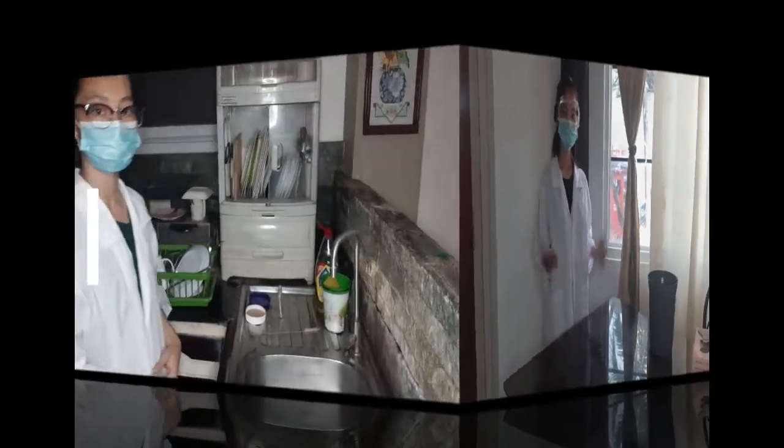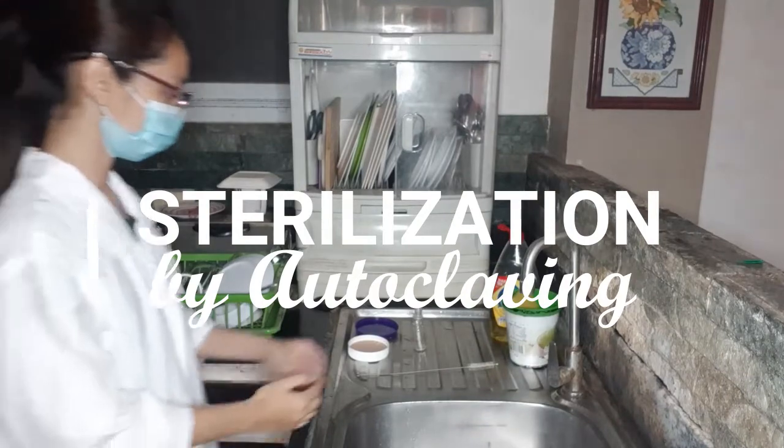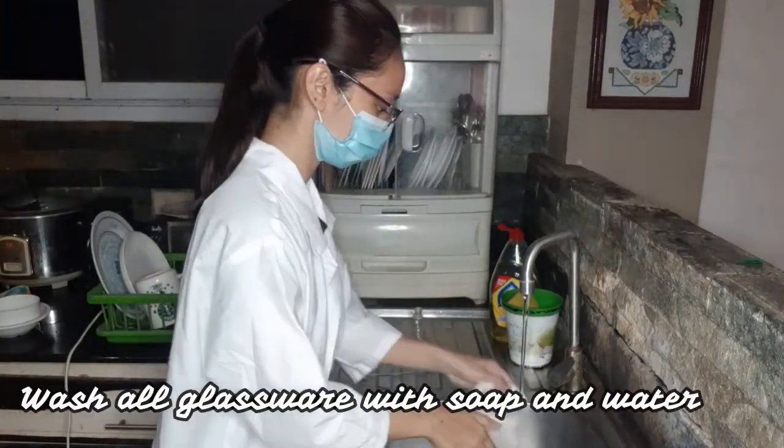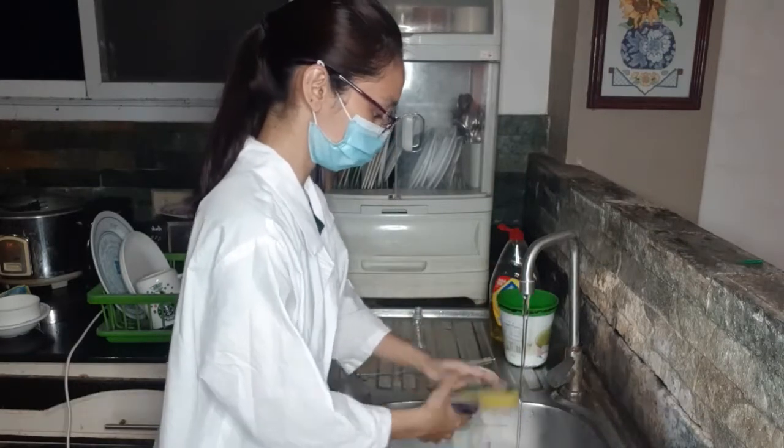There are two options in sterilizing, and one is by autoclaving. First step is to wash all glassware with soap and water.